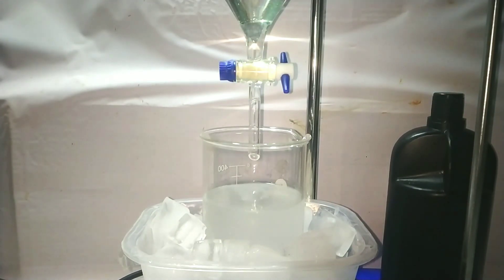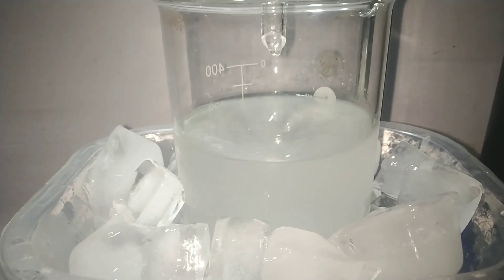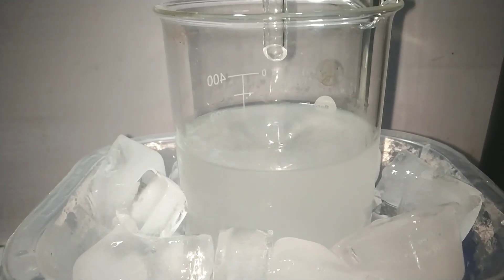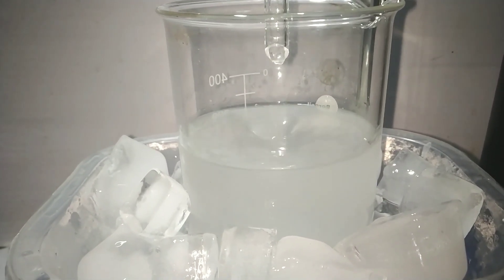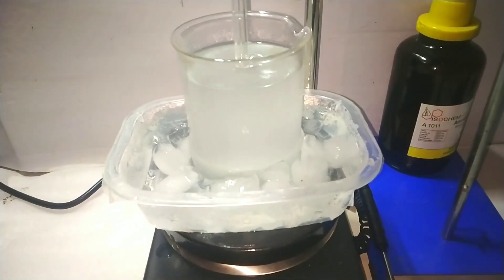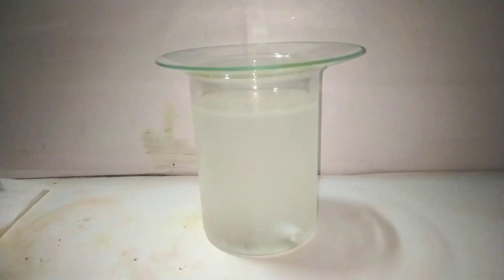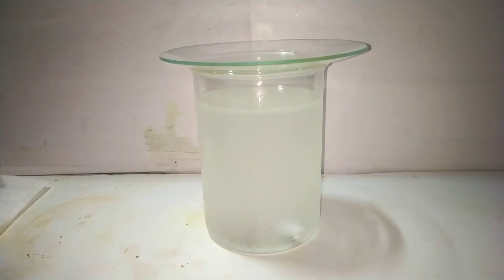Sodium hypochlorite should be added slowly and ammonia should be present in excess to prevent unwanted side reactions. Some amount of chloramine would be formed, so we should be doing this in a well-ventilated area or in a fume hood with all the necessary personal protective equipment.